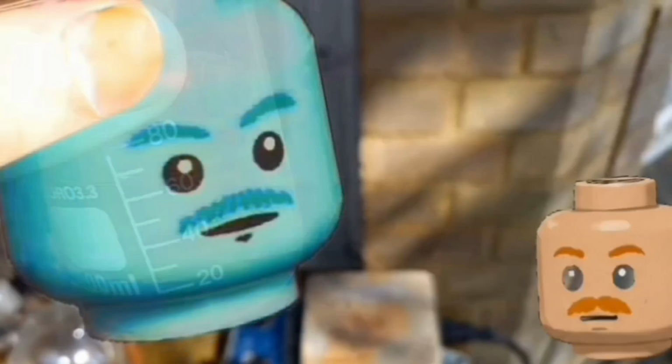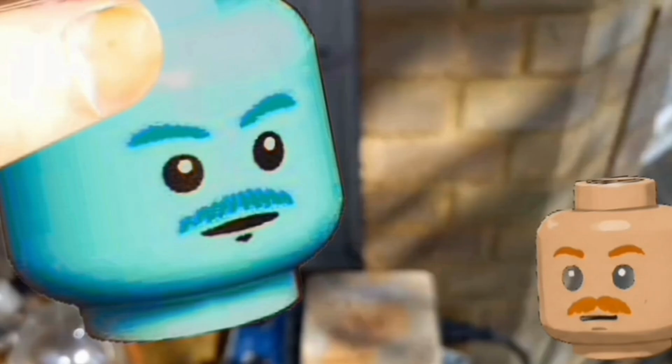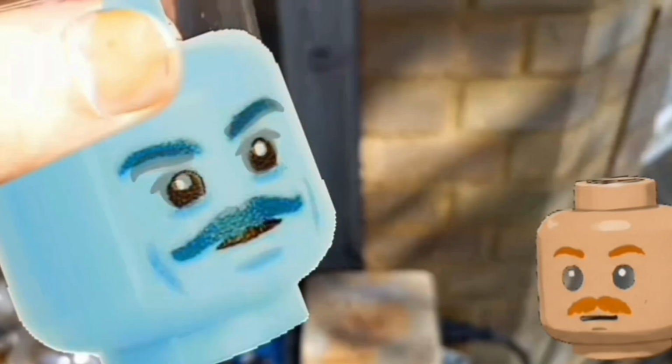Son, Father? Bring the bismuth nitrate. Here it is.